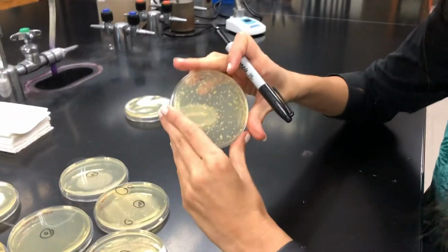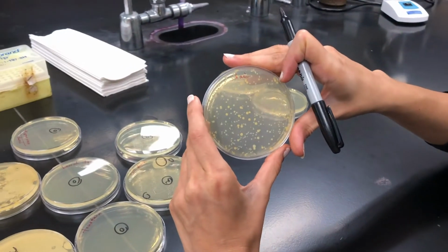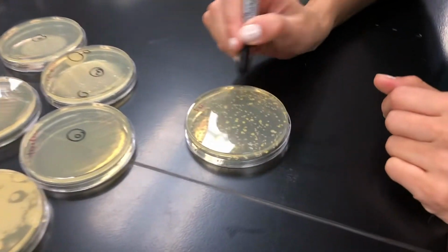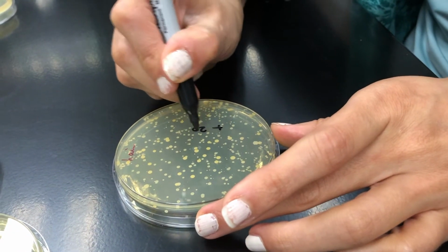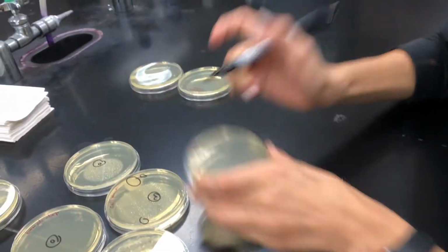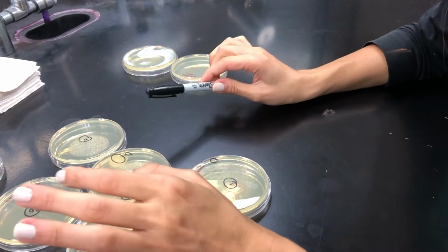But this is hair. Hair is another location which is pretty dirty. You can see that a lot of colonies grow when we grab a sample from hair. It's for sure more than 200. This is the doorknob, 1 colony. So you know that this is a different situation on campus.